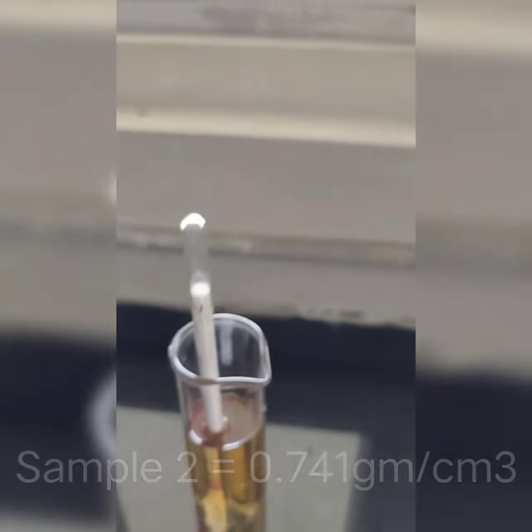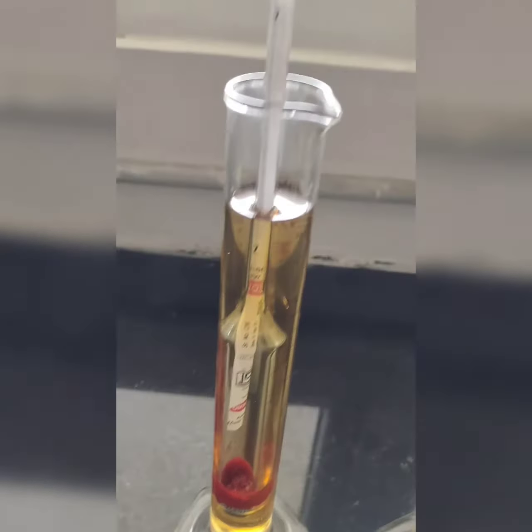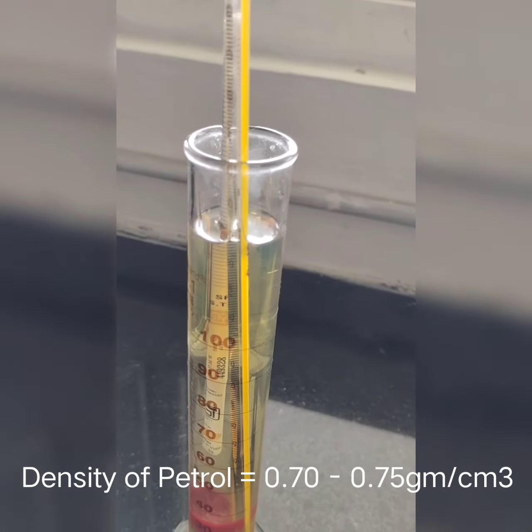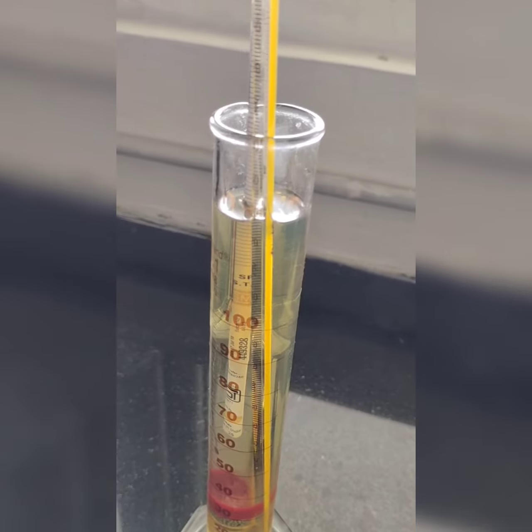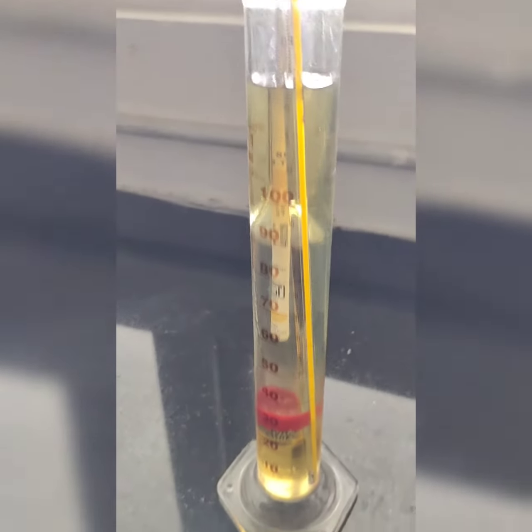That means 0.741 is the density of this particular fuel we have taken in this. So probably it is petrol, but this one which is 0.791 is not petrol, it is adulterated, or it could be kerosene, but the color is not of kerosene. Okay, it is dyed in the petrol color.